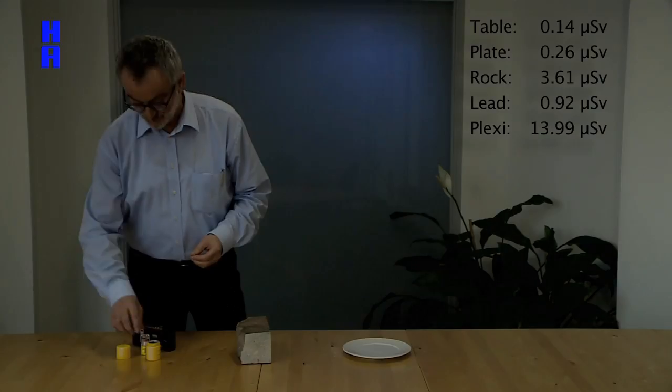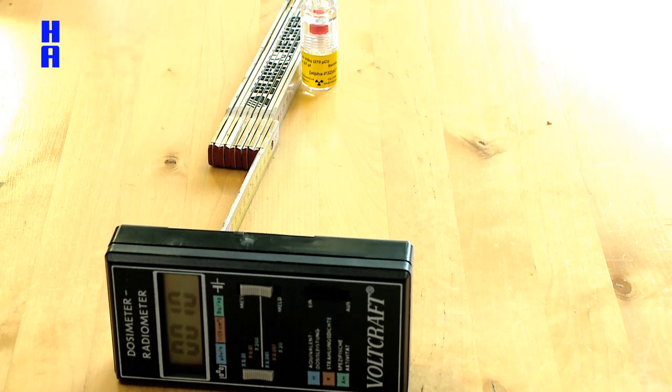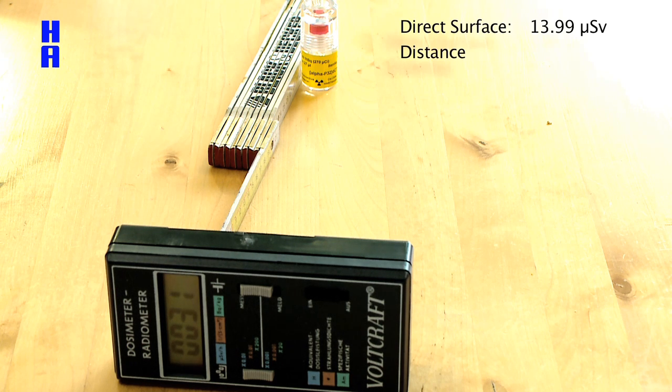Thank you. Please remember the value measured at the direct surface of the plexiglass vial as compared to the distance of 30 cm.